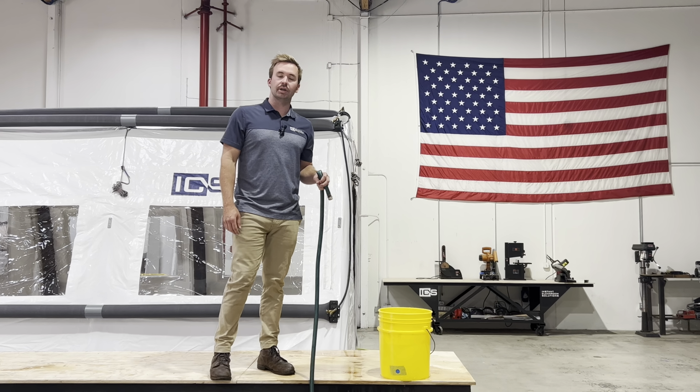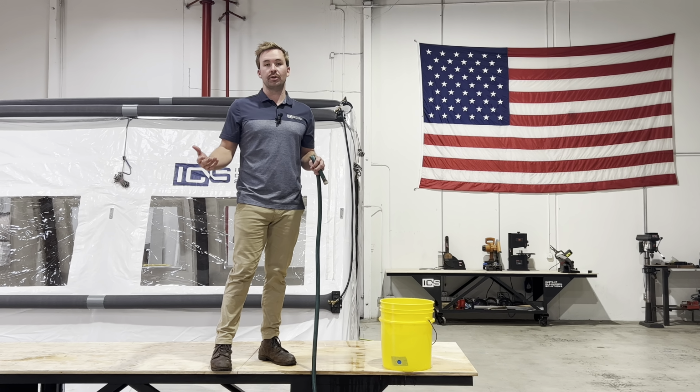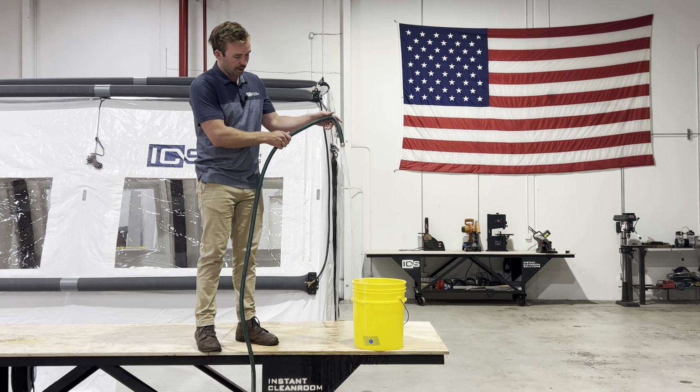All right, today I'm going to show you guys a little bit about laminar flow and turbulent flow, and then we're going to go inside and take a look, and I'm going to lay some stuff out on a whiteboard and describe both of them and let them know why they're important for your clean room and your design considerations and your industry. So let's start out with non-laminar flow.